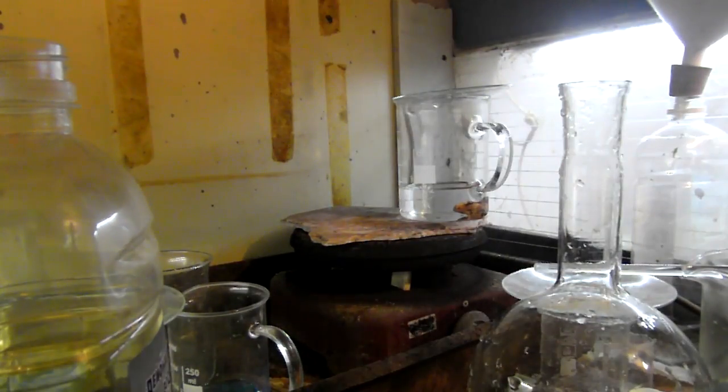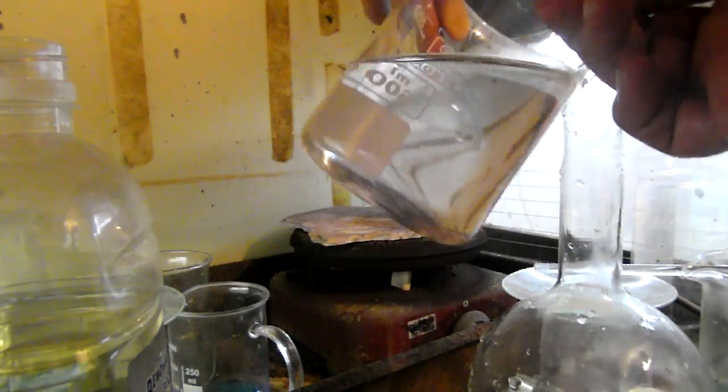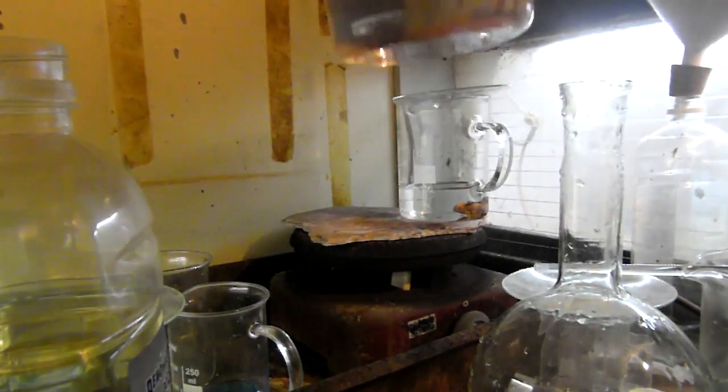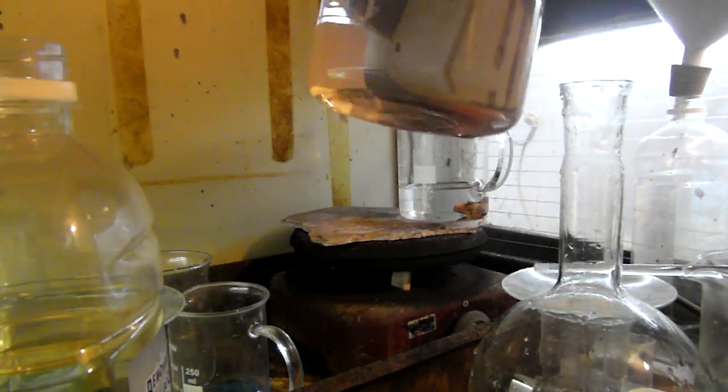At this point I decanted the now clear solution into a round bottom flask and moved the gold clumps to the beaker with the gold mushroom.